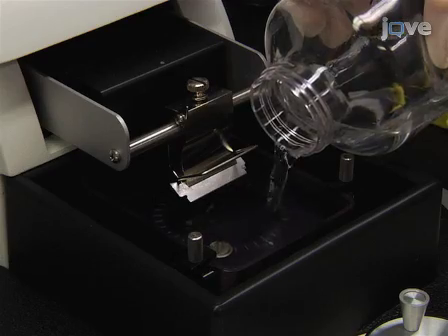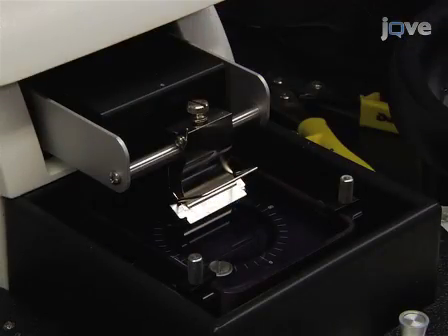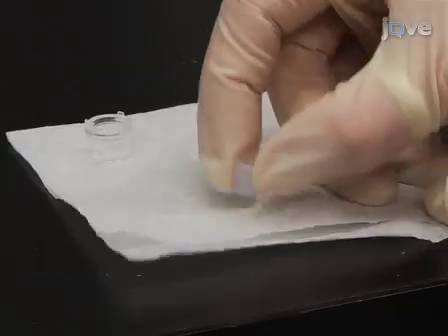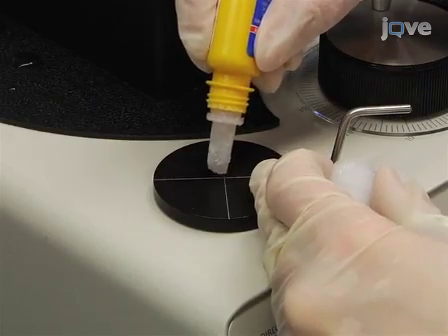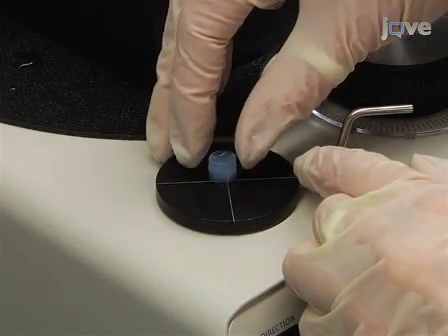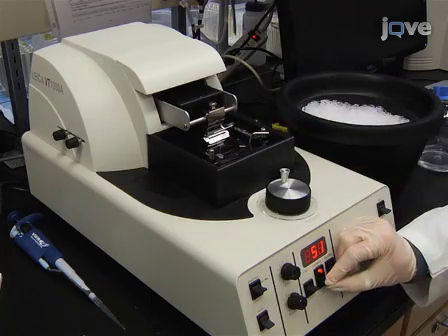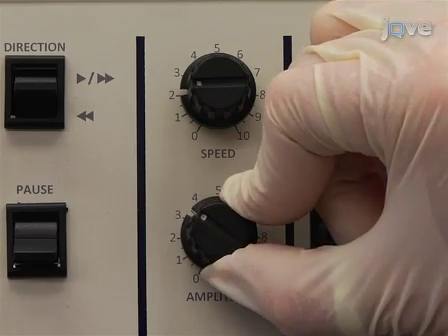Prepare the deluxe specimen bath by filling the bath with PBS and packing wet ice around it. Before mounting the tissue embedded in the plug, remove it from the ring mold and blot dry the bottom surface. Then glue the dried surface to the mounting disc using loctite adhesive. Insert the disc into the vibratome and adjust the section thickness to 50 microns, the speed to 2, and the blade amplitude to 4.